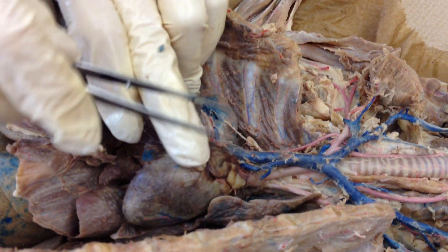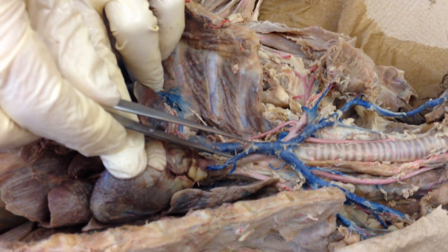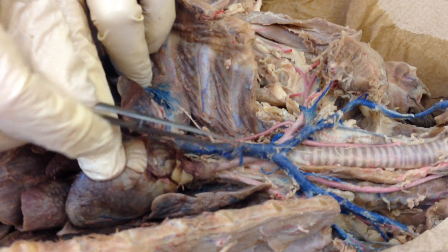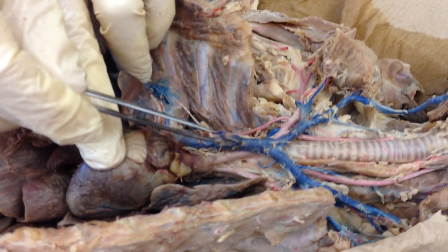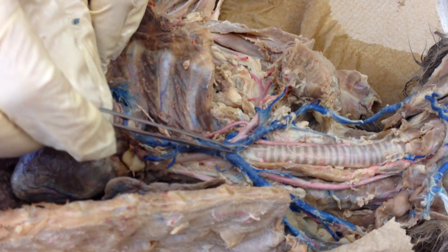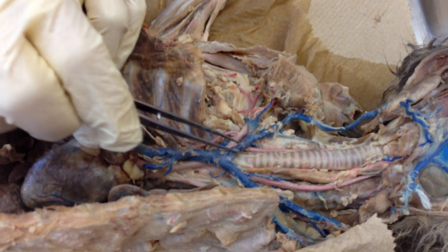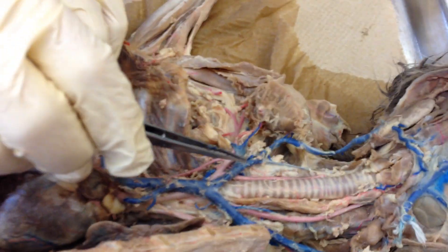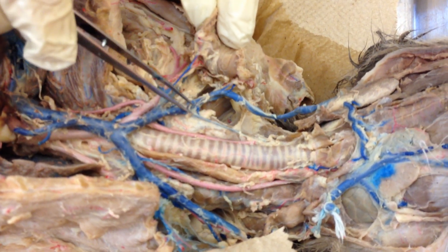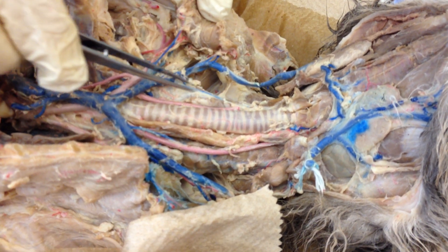Going back to the superior vena cava, the first big branch is the azygos. Moving up, this branch is called the internal mammary or thoracic — a single one coming straight off the top. Then going up the superior vena cava, you have a main branch, this big Y — this is going to be the left and right brachiocephalic vein. The brachiocephalic vein branches into the external jugular and the internal jugular going up the neck. The external is the large one, internal the small one.